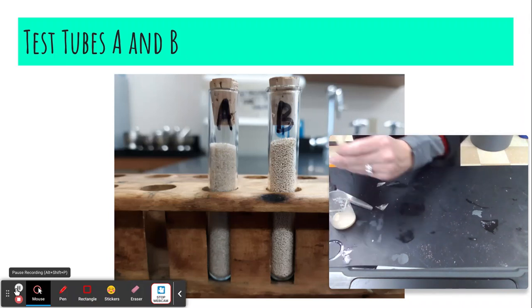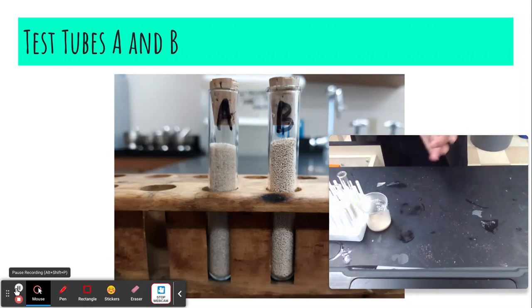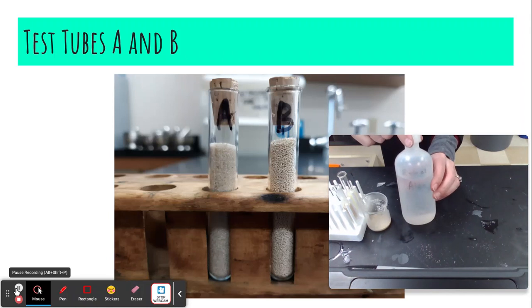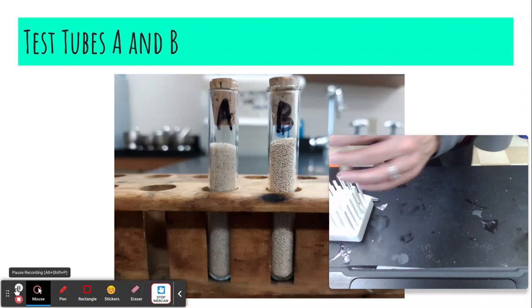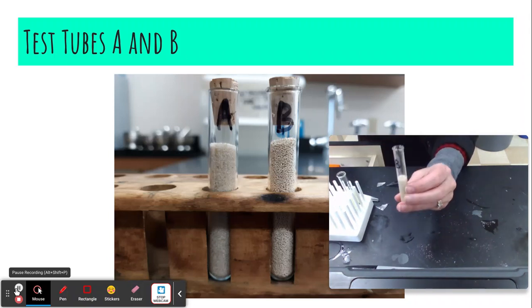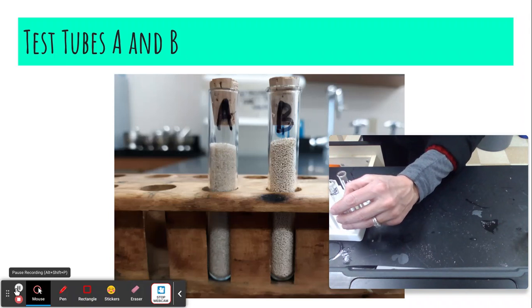There we go. And now the instructions say that we need to add ethyl alcohol. My ethyl alcohol is right here. This is nothing anybody would want to drink. It's very bad for us. And we're going to add it to the two samples. So here's my B. I'm going to add the alcohol. It's very cold alcohol, and I'm going to add it. And then I'm going to let it sit for a moment.